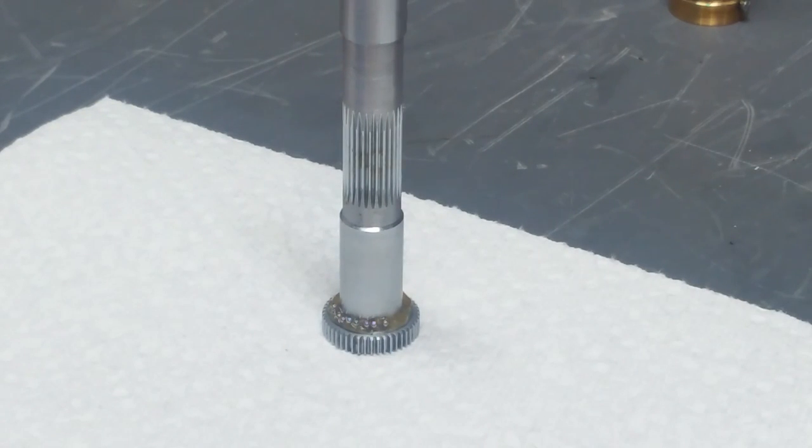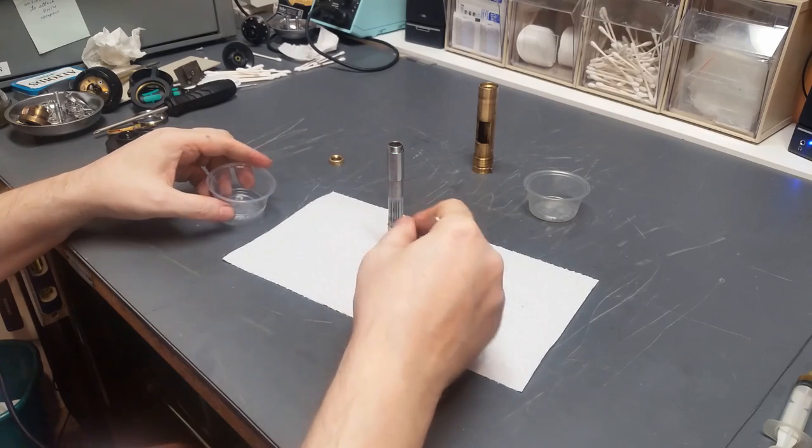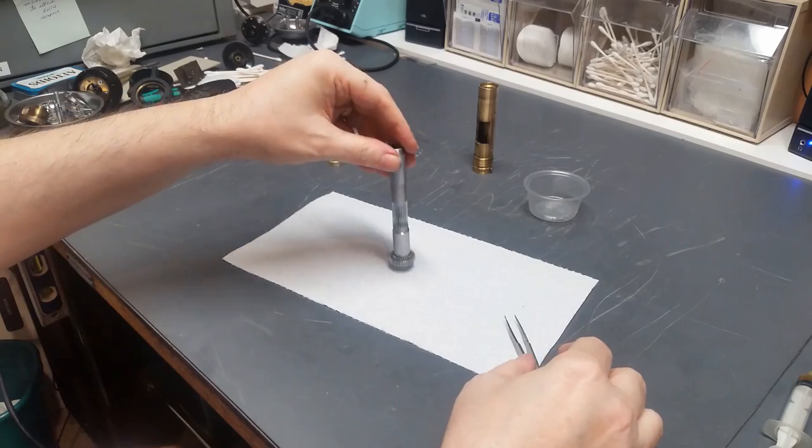Okay, I'm going to finish up the rest off camera. You don't need to watch all this. I'll be back shortly. Okay, I've got 30 of them, all of them installed around here.